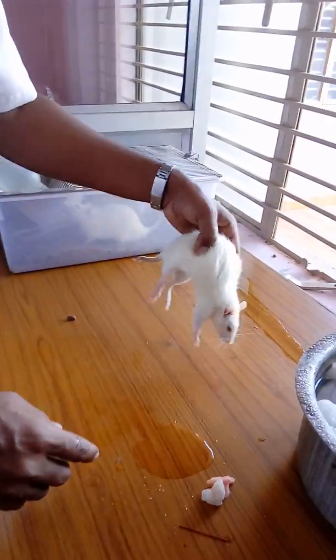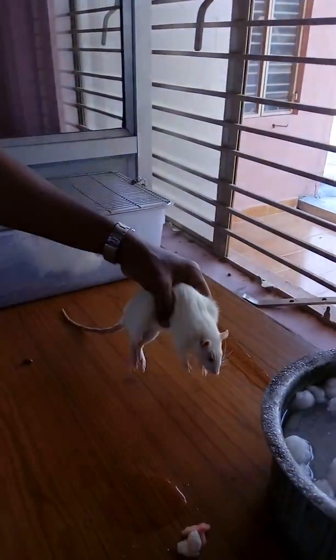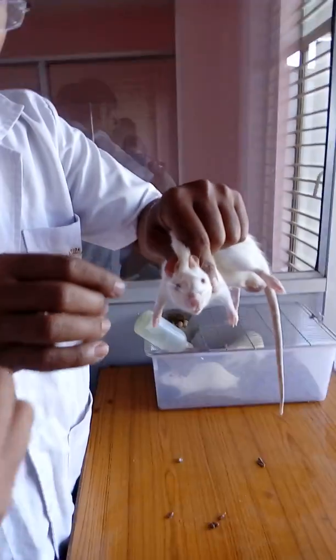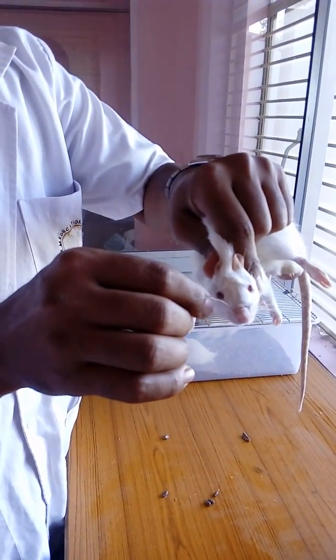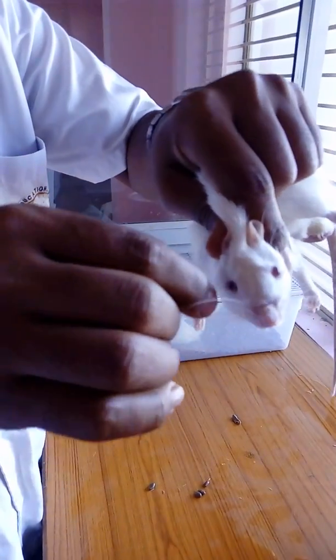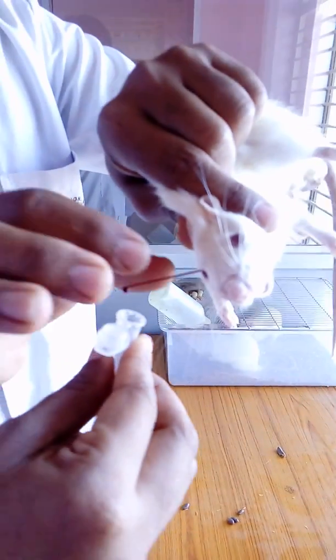For the second rat, we will again perform the retroorbital collection from the nose side toward the ear side. The blood is now coming out.